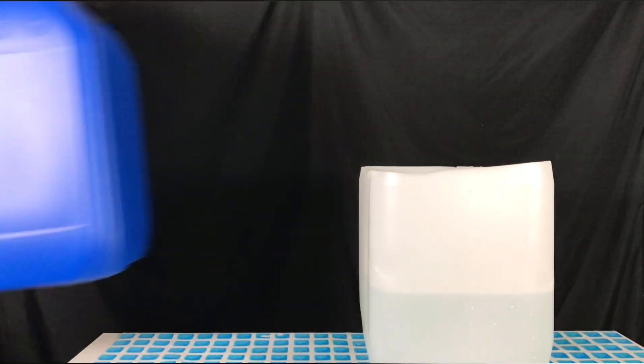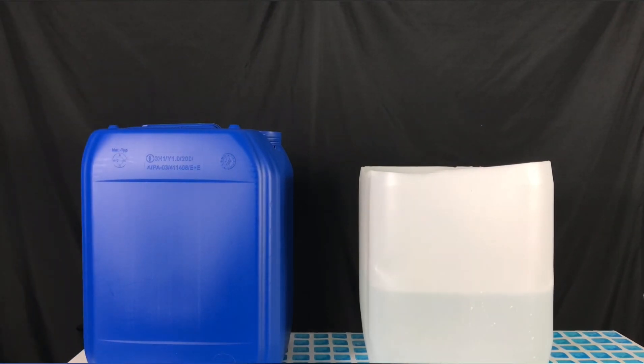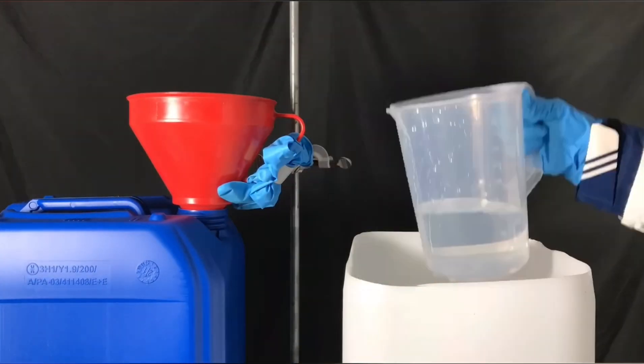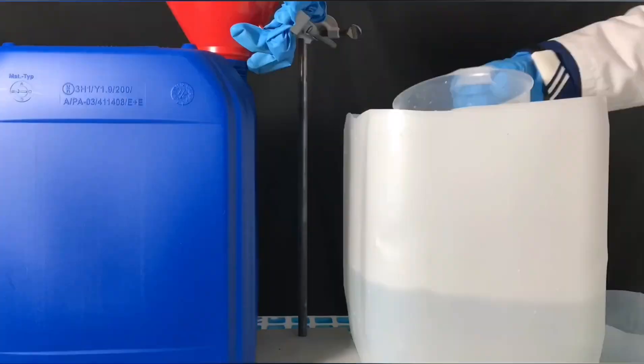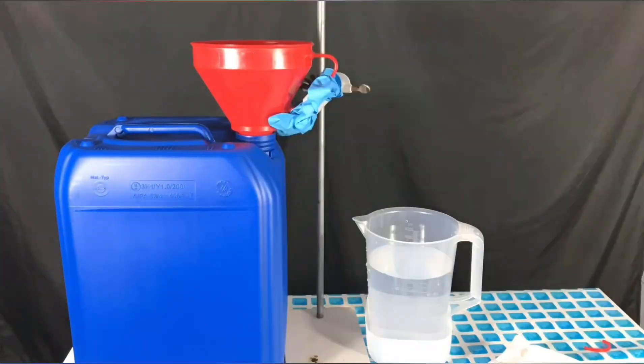Once the acid has been prepared, it was transferred to this big 20-liter canister. We are doing this enormous amount of work simply to keep our acid legal and to still be able to use sulfuric acid in the future.